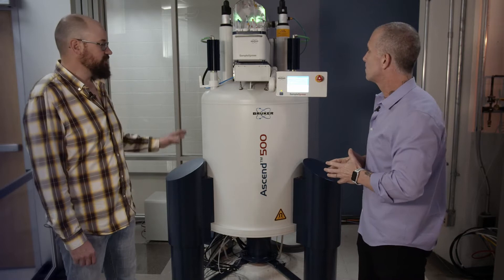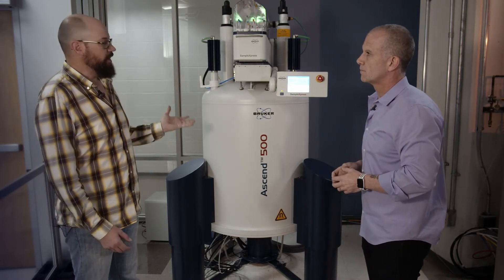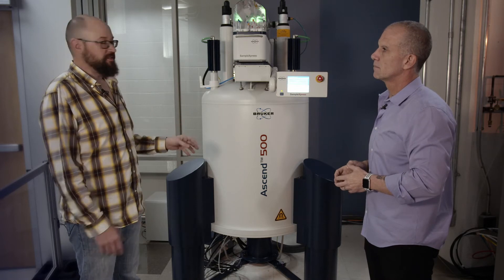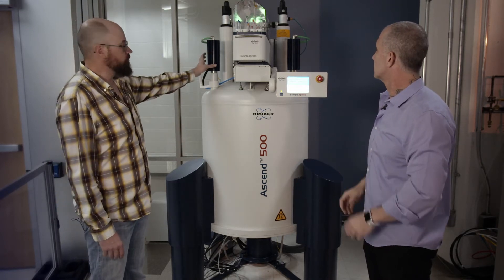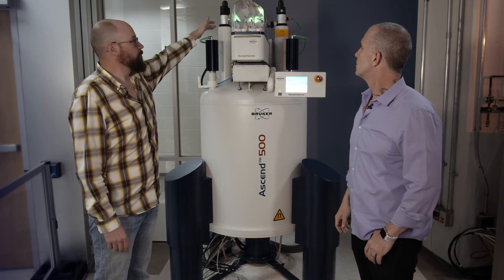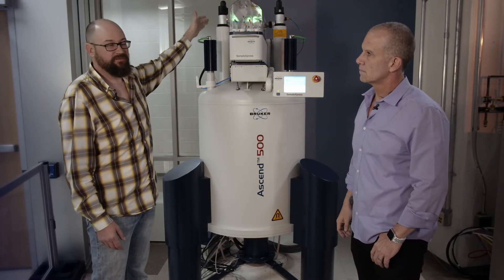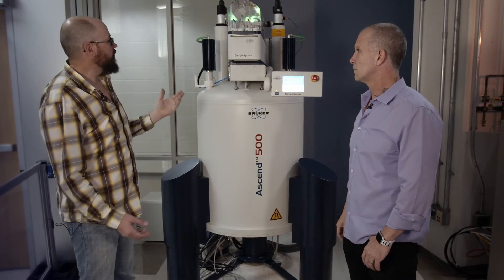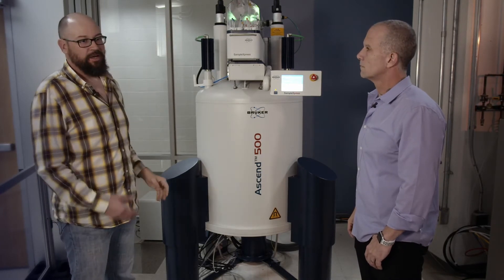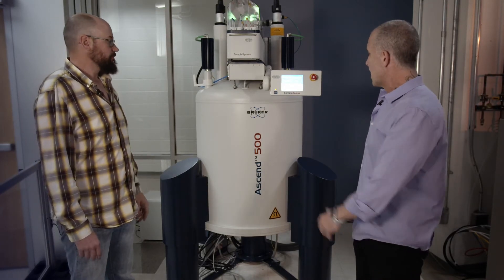The first thing you see here with this superconducting magnet is we have to keep that magnet superconducting, so it takes cryogens. In this case, we have an outer dewar that's filled with liquid nitrogen and an inner dewar that contains the magnet coil itself, filled with liquid helium. One of my main jobs is to replenish that helium and liquid nitrogen on a routine basis.